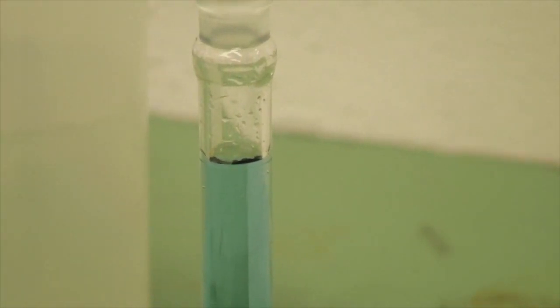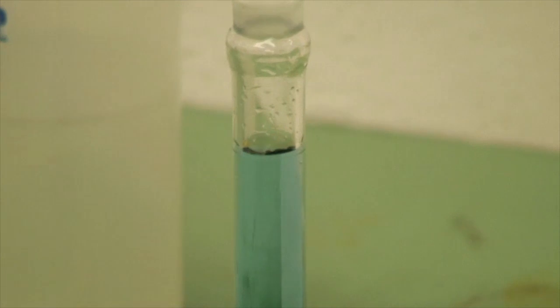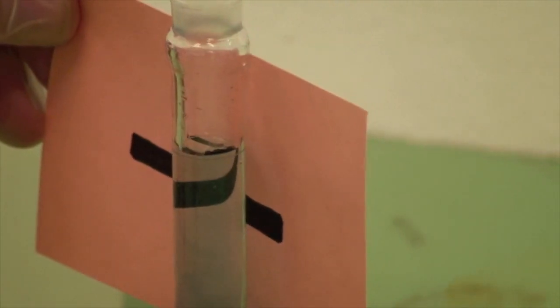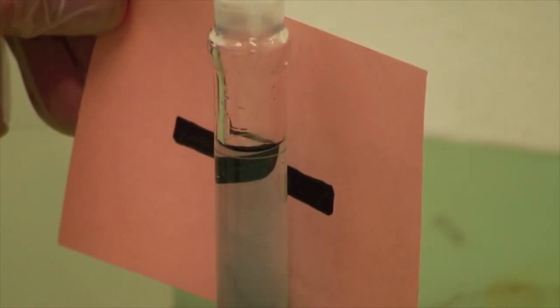If you want to, you can use a burette reader card to make that a little more obvious. I think I've got about one more drop to go here. There we go. And two drops.